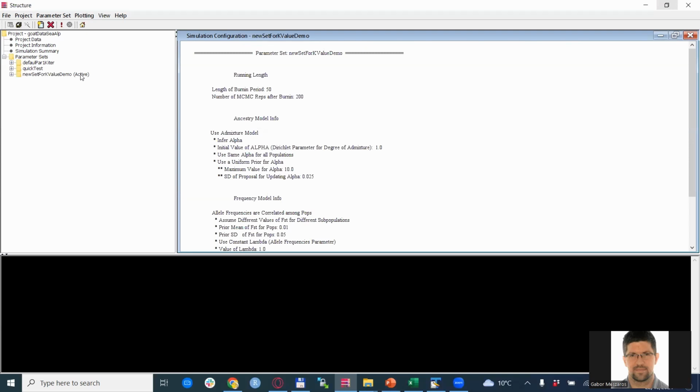Now, if you want to do just a single analysis, you can click this exclamation mark here that says run, and you can set the number of populations assumed, so this would be the K value. Doing it manually for so high a number of K values, and especially so high a number of iterations, would be time consuming. Fortunately, there is a better way. You click Project here on the top side and click Start Job.